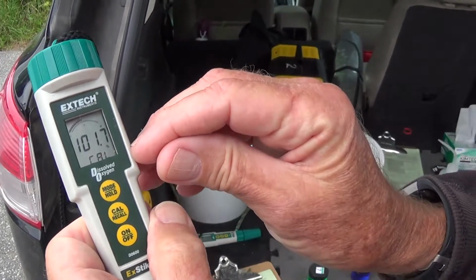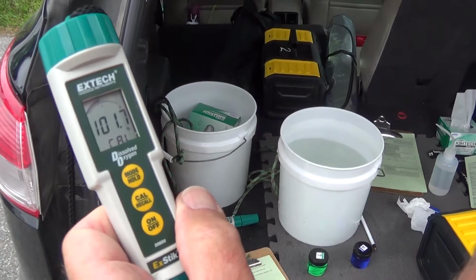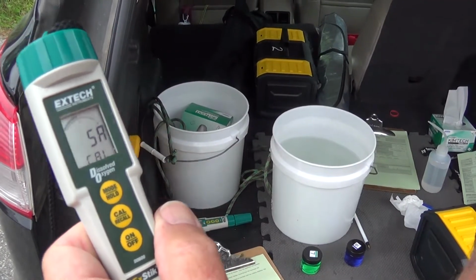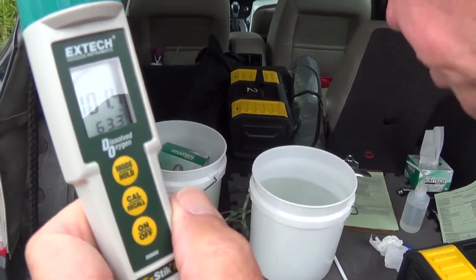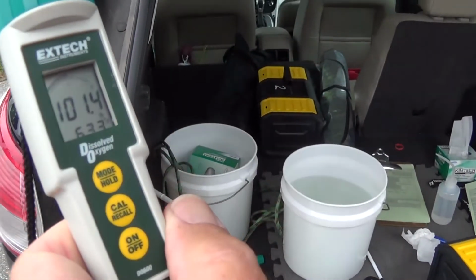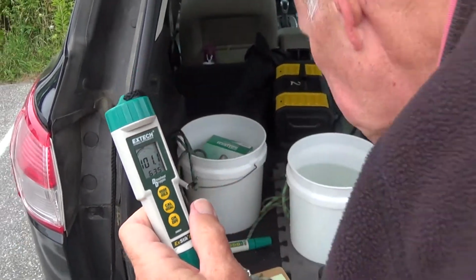And there's cal. And it will say, we're looking for SA followed by end. And we did that.